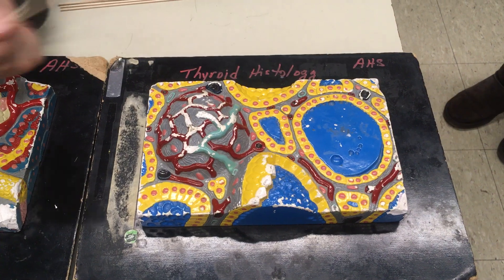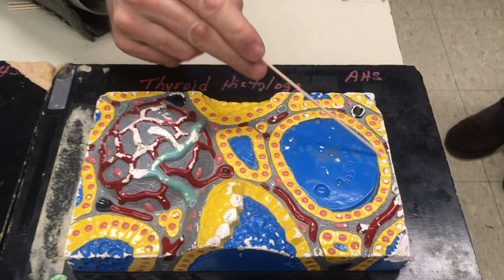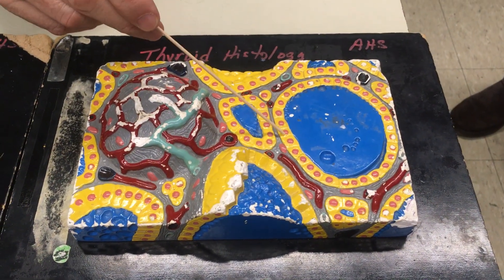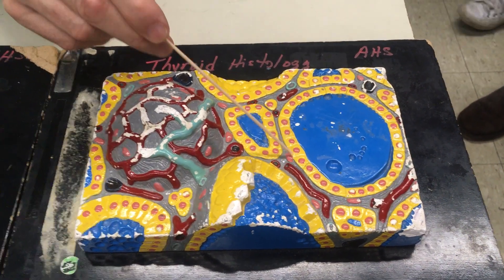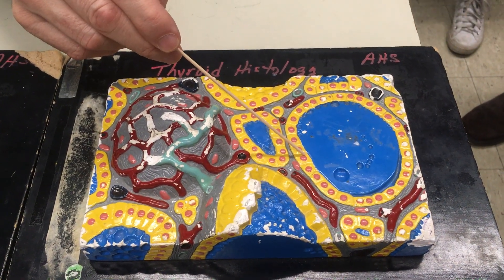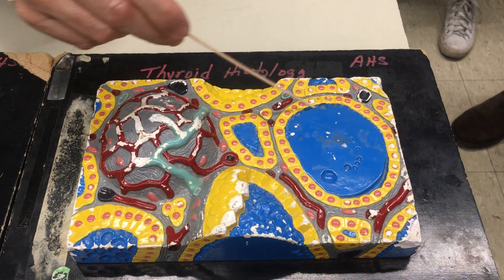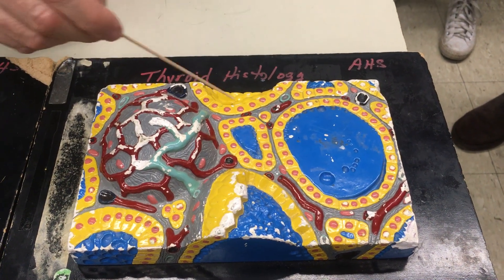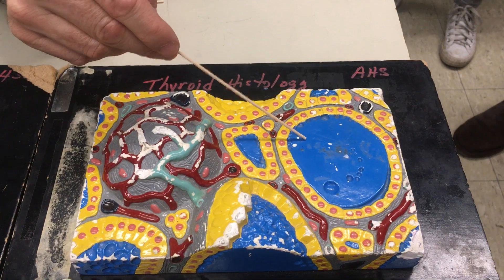The follicles are constructed from cells called follicular cells. They're simple cuboidal epithelial cells — yellow cell, pink nucleus. Inside the follicle, on the colloid side, you have what's known as the colloid.